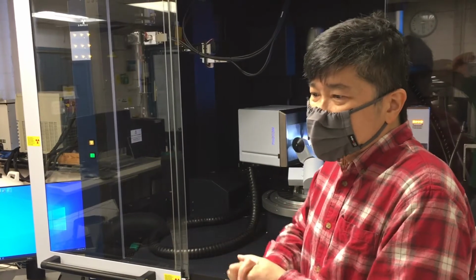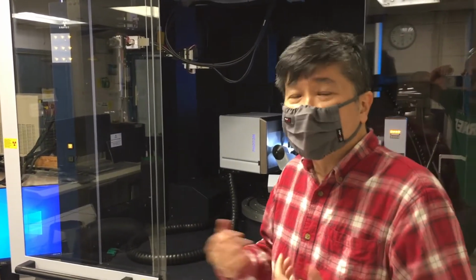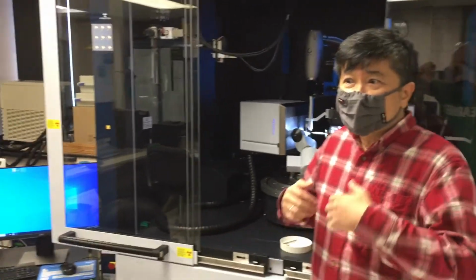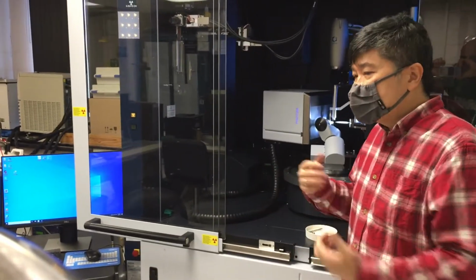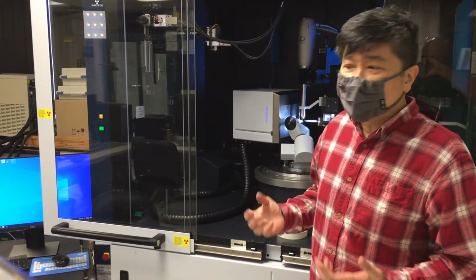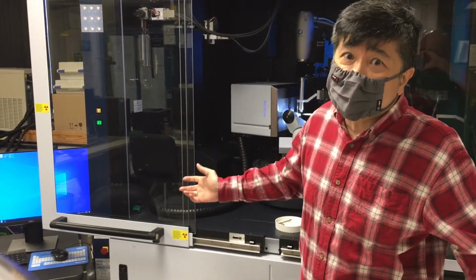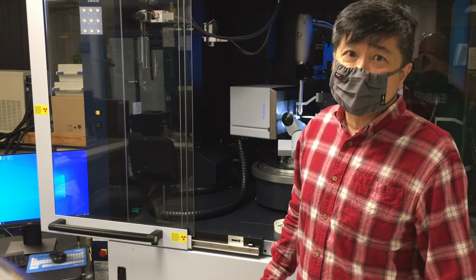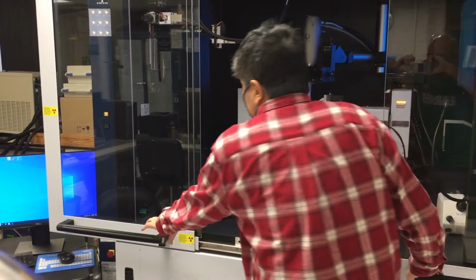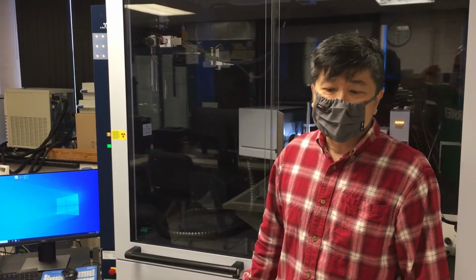Back in the day, for instance, it wouldn't be surprising to do a small molecule structure in like 4 or 5 days. Now, we could put in a crystal, and in 4 or 5 hours, we could have a crystal structure. Obviously, if we are screening proteins, proteins are very big molecules, it will take a longer time. This diffractometer, for instance, was purchased specifically to screen protein crystals.